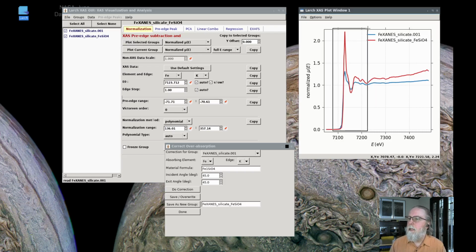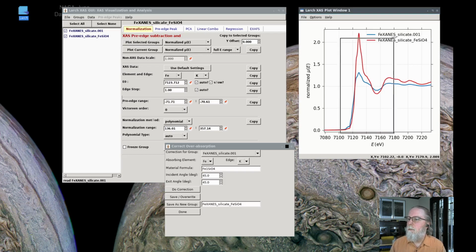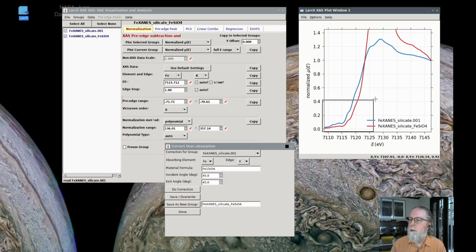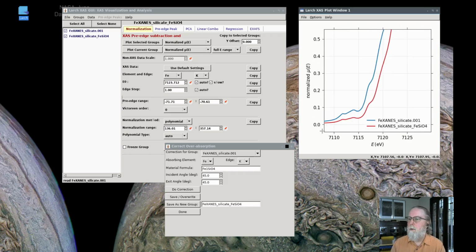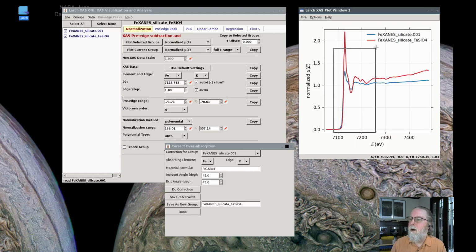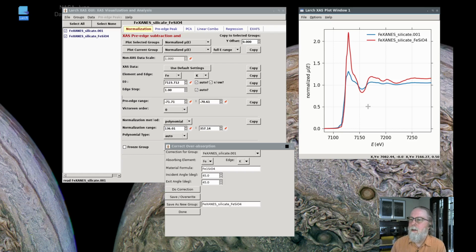What's important about that is that you can see that while the edge step is pretty good, it actually moved the relative energies of the main edge, as the correction is much larger as the absorption goes up. It also then, relative to the edge step, made the pre-edge peaks larger in total. It didn't really move the pre-edge peaks in much detail, but a little bit. So doing any analysis on fluorescence data where the absorbing element is a major component of the sample, stoichiometry can be important to do these kind of corrections, at least to first order.